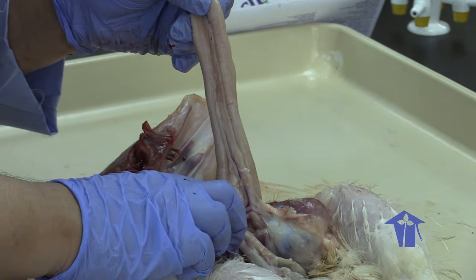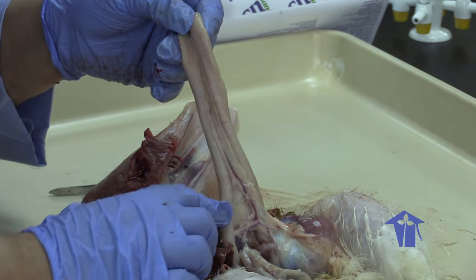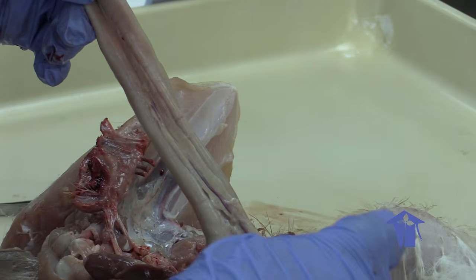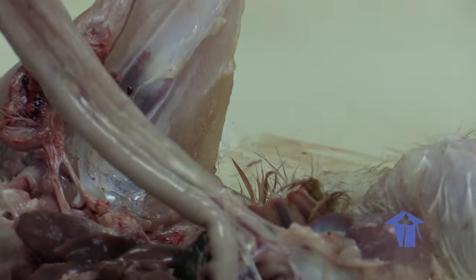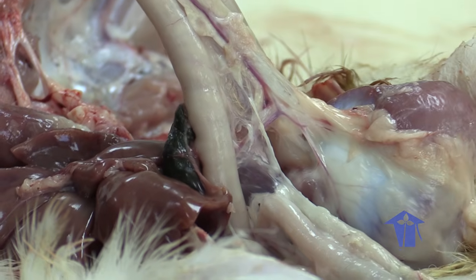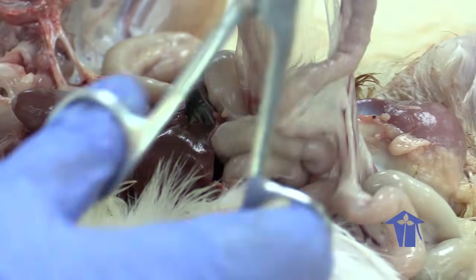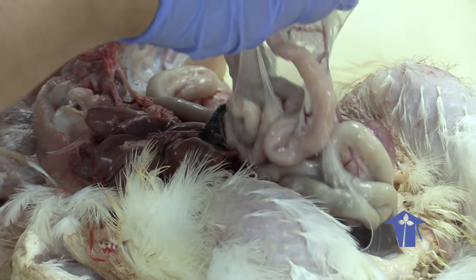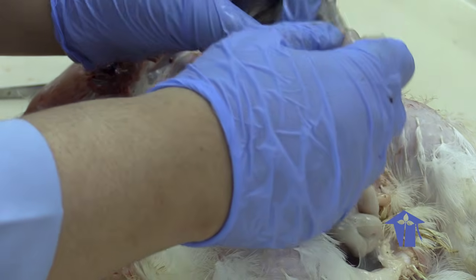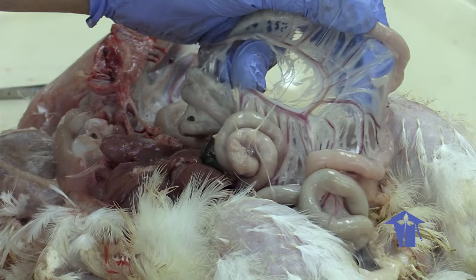And you can see the blood vessels. This all is very highly vascularized. The pancreas has a lot of secretions that help to neutralize the contents of the stomach, and it also contains a lot of enzymes for breaking down the sugars. Okay. And some proteases as well. And then, of course, you have your small intestine, right? And you can see your blood vessels, because this is a very absorptive structure.